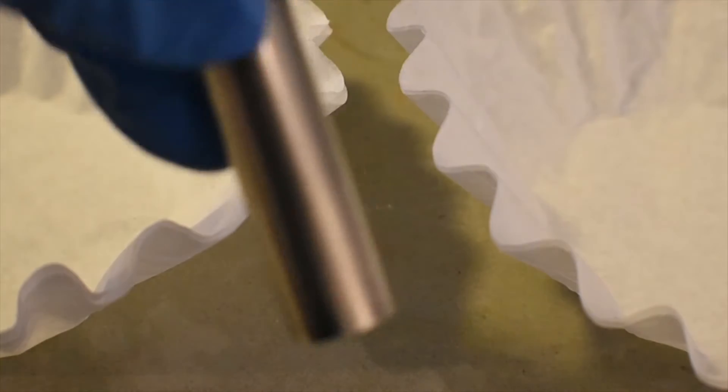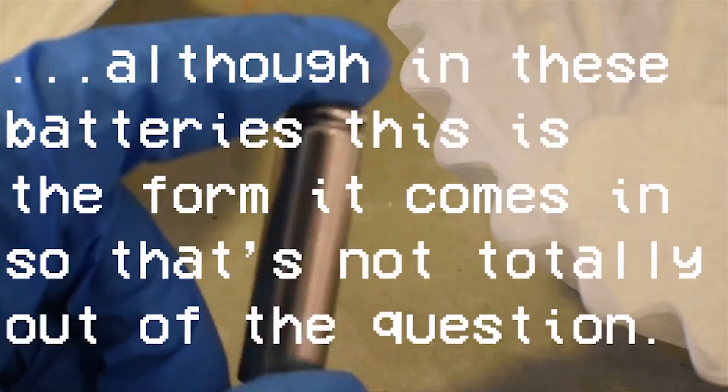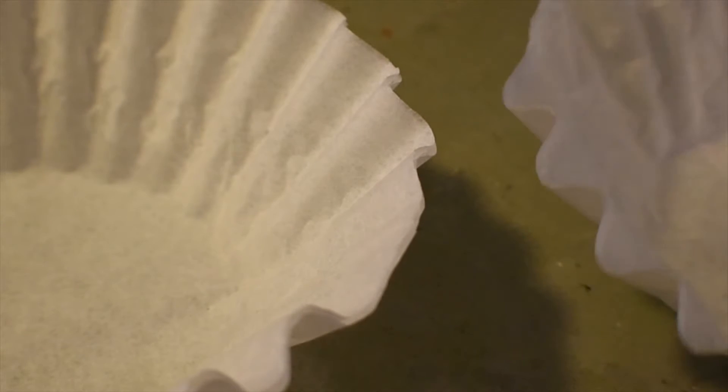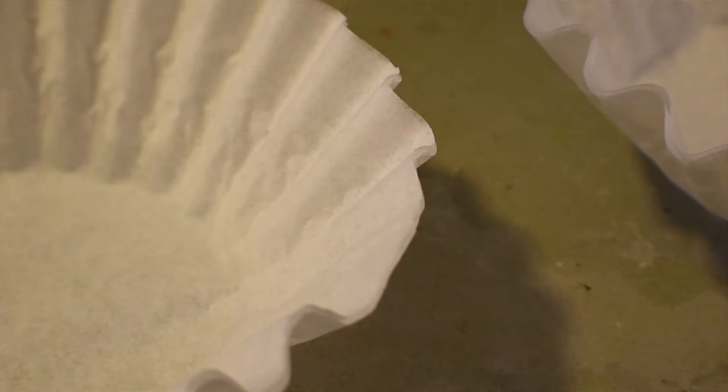This battery contains cadmium, but there isn't really a good way to tell what the cadmium looks like inside because there are three different materials contained in it — and today I'm going to show you which one is cadmium. I'm not planning on extracting the actual metal per se, but rather making a compound: cadmium carbonate. Now, before I open up that battery, it's mandatory that you wear gloves during this procedure. Cadmium and its compounds are very toxic and carcinogenic, so you absolutely cannot have them getting on your skin or in your eyes. I also suggest wearing goggles.